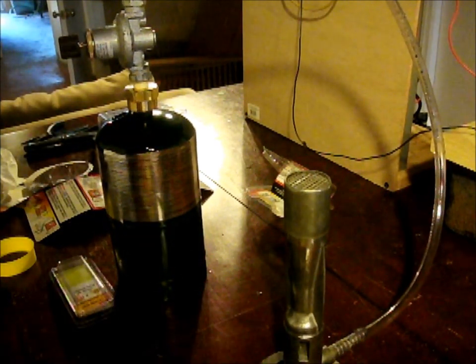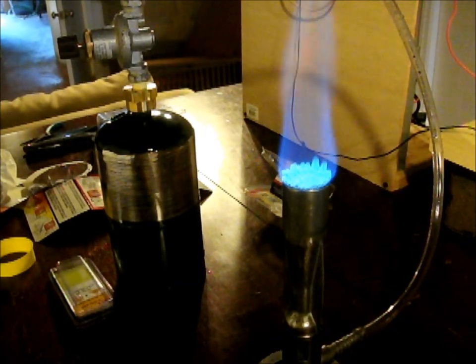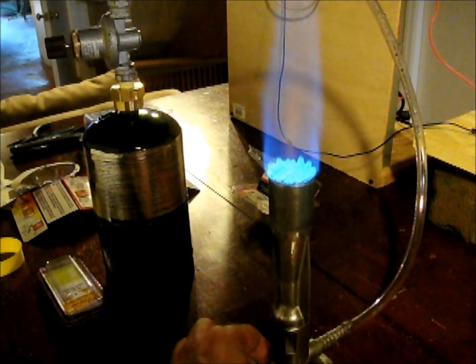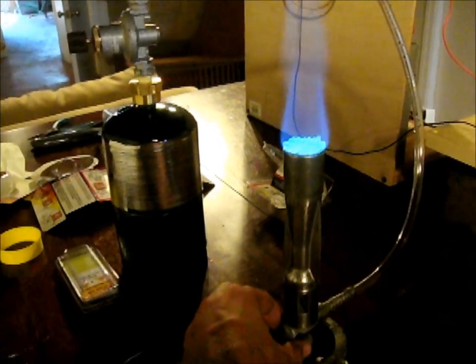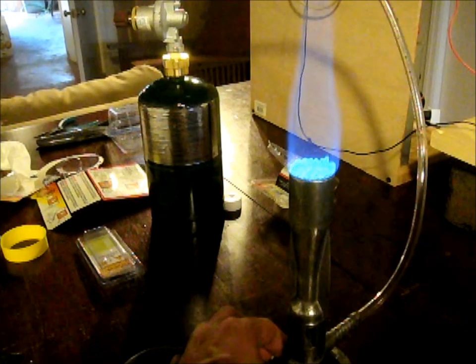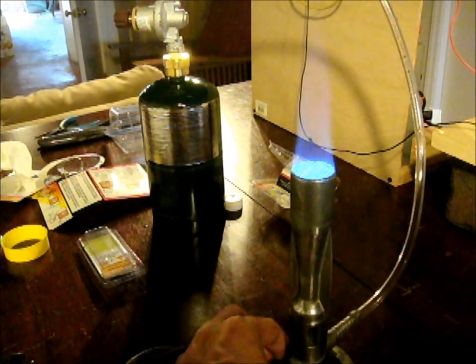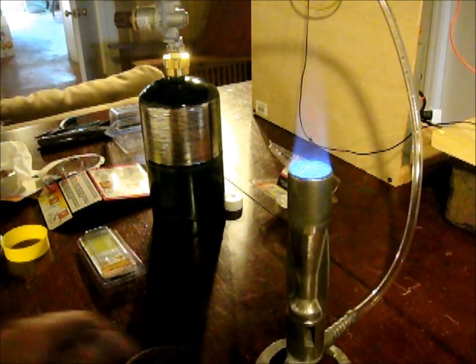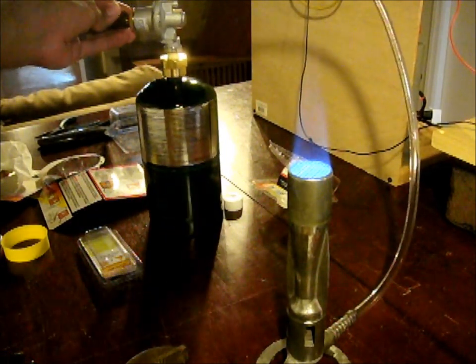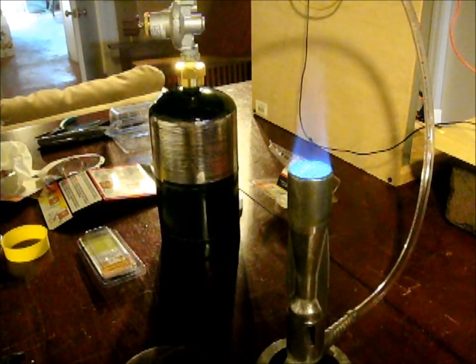You can hear some hissing. There's a little adjustment knob here — we don't want that to melt the hose. We just adjust that knob and we've got a nice steady flame at a good pressure. We can regulate our pressure up or down with just a little twist of the knob. And we'll be ready to do some glass experiments.